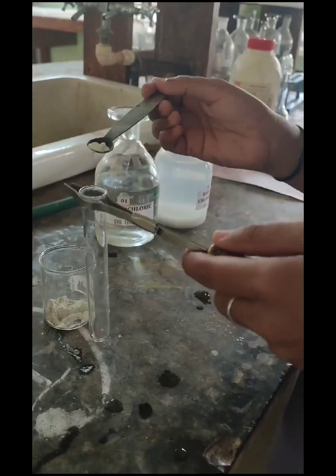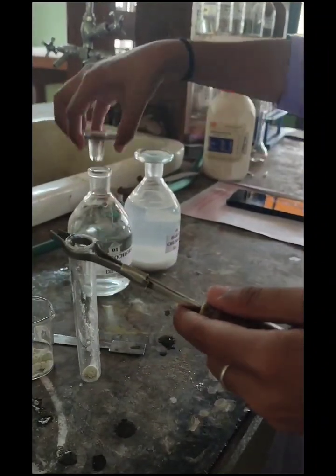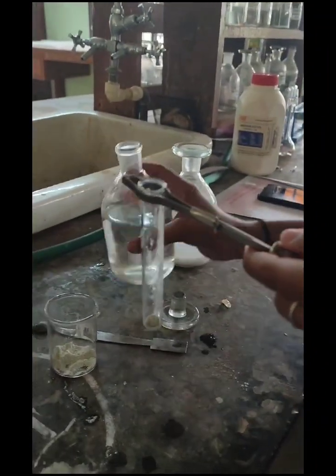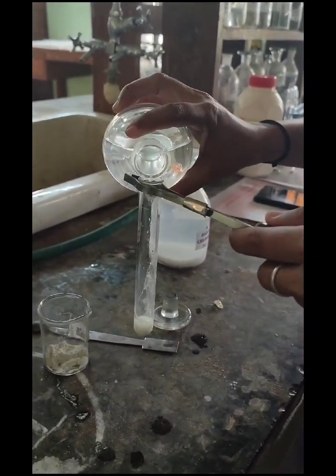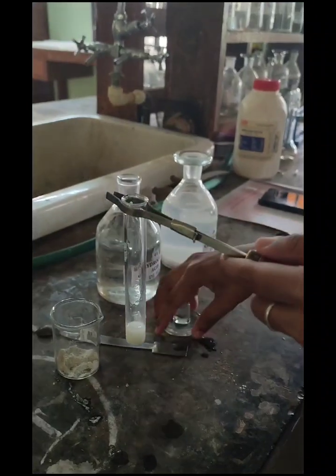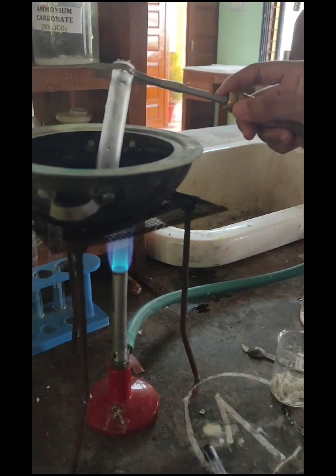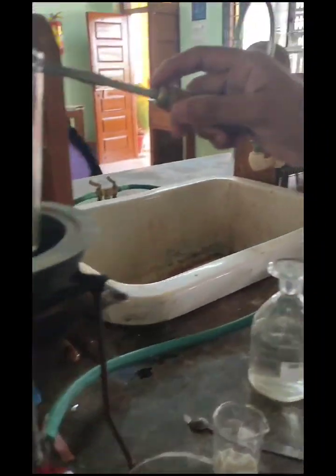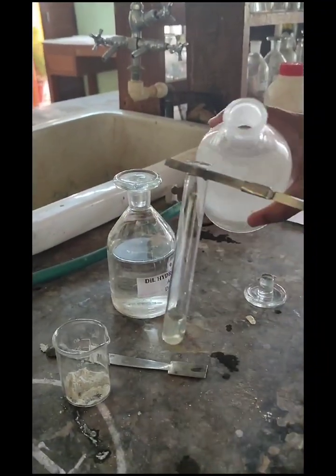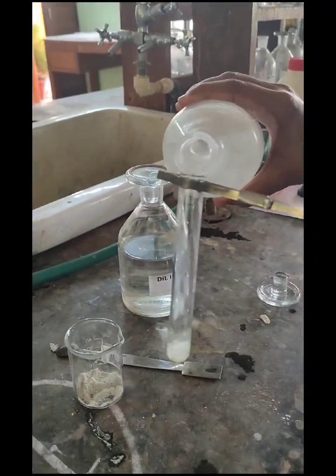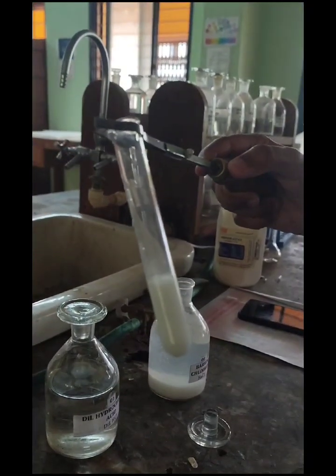Add a small amount of mixture. To that, add some drops of dilute HCl. Heat till the CO2 is expelled. Add some amount of Barium Chloride to this solution. A white precipitate is formed, indicating sulfate is present.